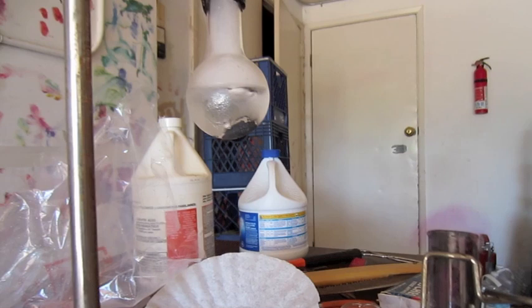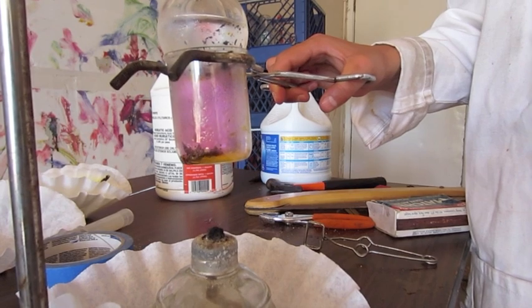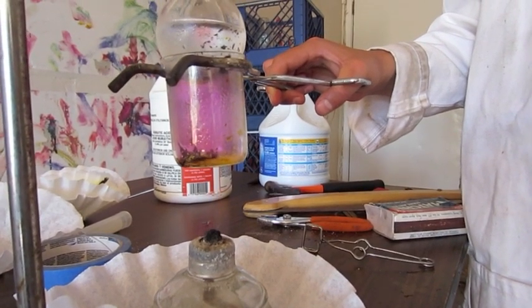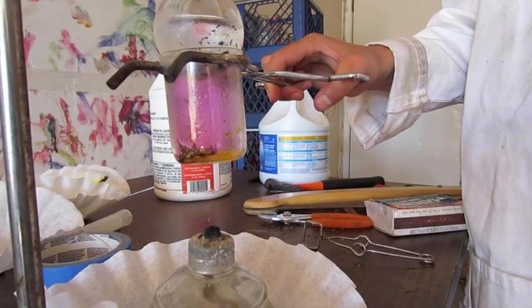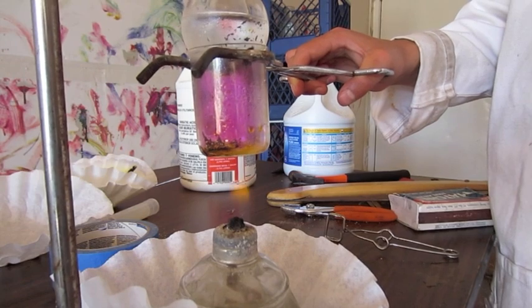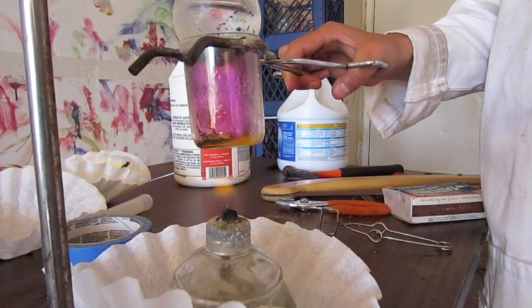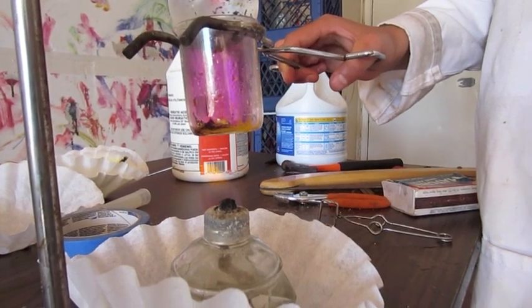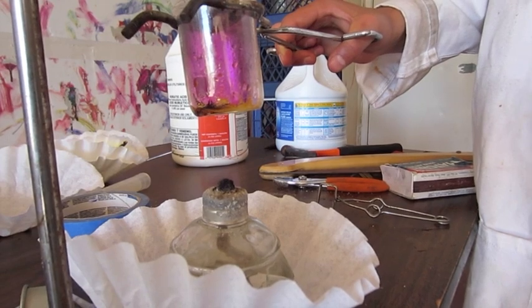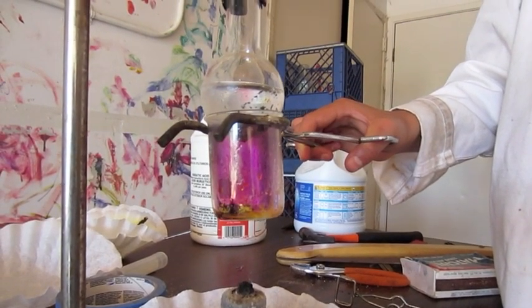Here is the end product. It's a little bit of iodine on the bottom of the flask. Here is me purifying the main part of the product. I added a little bit of liquid in there on purpose, so that the water vapor would help to bring the iodine vapor up, and the iodine could travel easily up to the Florence flask. And basically it's the same exact principle.